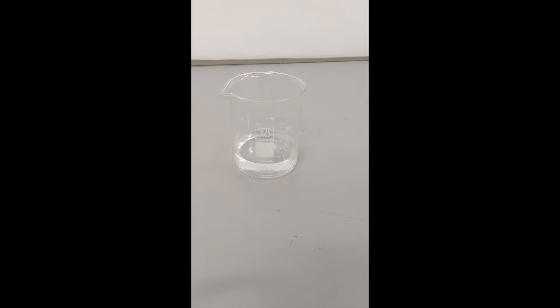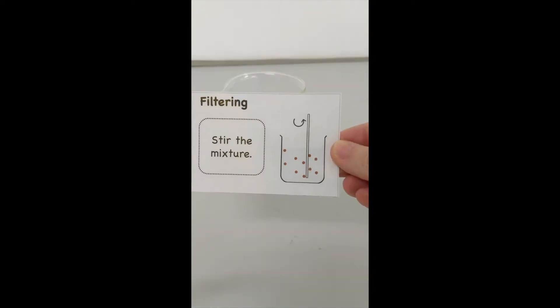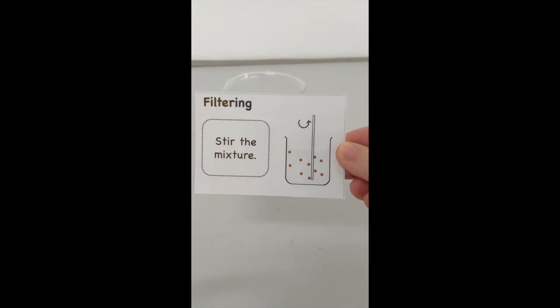Start by getting some water from the tap and add two spatulas of rock salt to the water. Then stir the mixture with a glass rod.